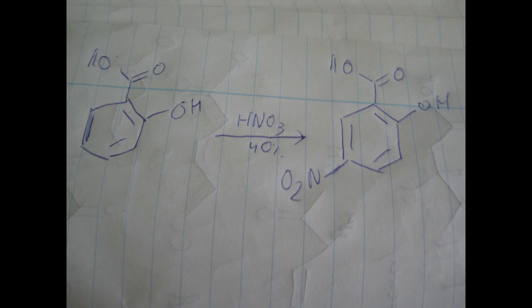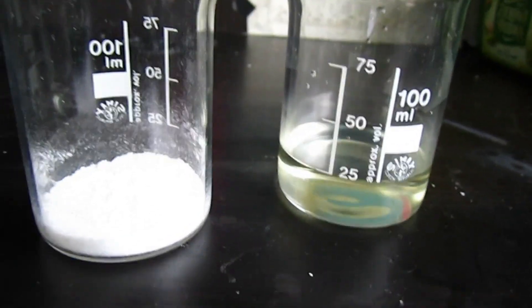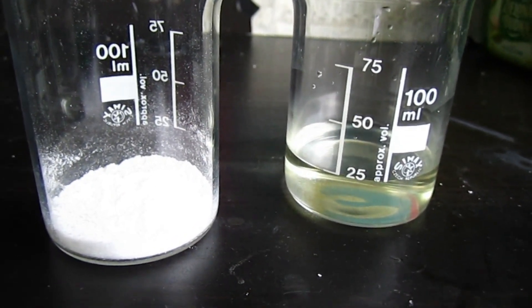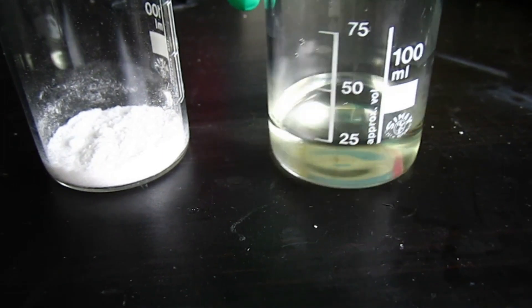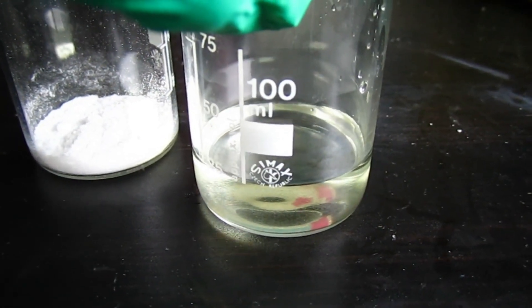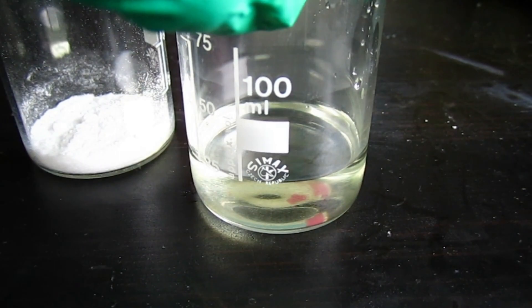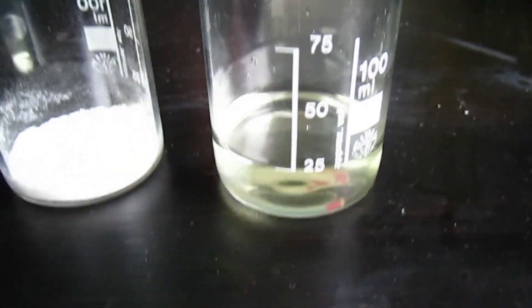Hello everyone. In today's episode I will try to make some 5-nitro-salicylic acid by this reaction. I have measured out 5 grams of salicylic acid and about 28 grams of 40% nitric acid.